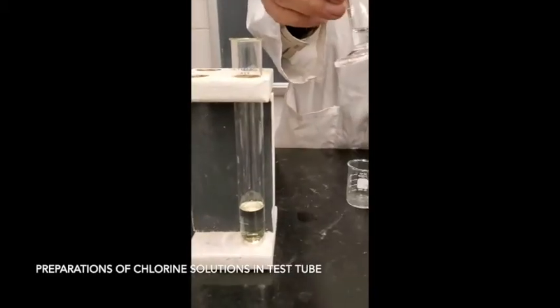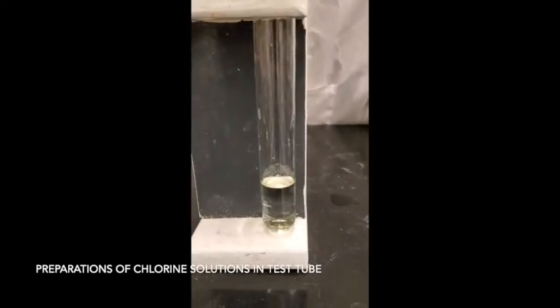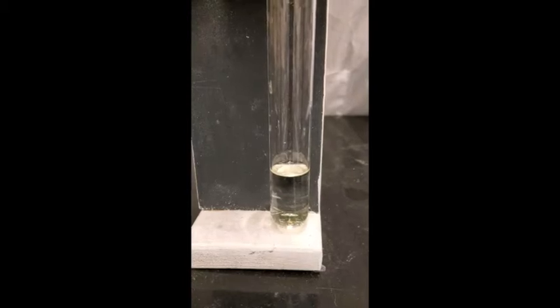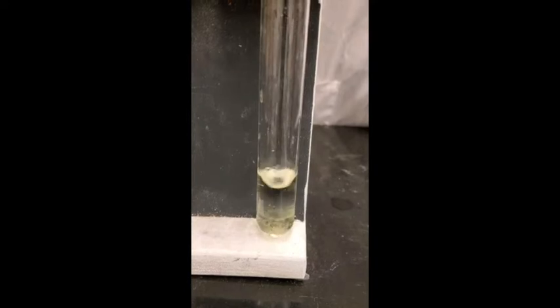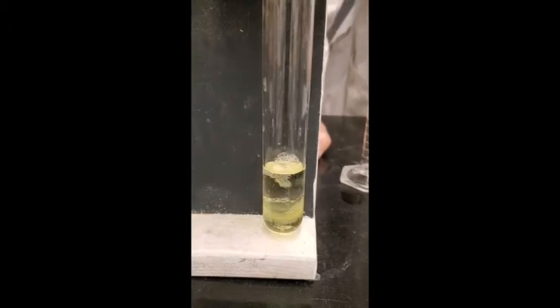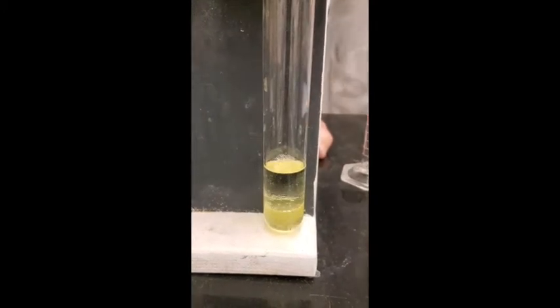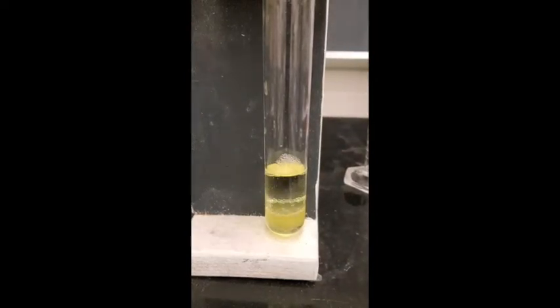Everybody, I have just a little bit of hydrochloric acid in here. I'm going to add it, and you're going to see the same reaction we saw before in that big cylinder, except that the chlorine is very soluble in the hydrocarbon. So any chlorine produced will dissolve primarily in that hydrocarbon. See, it's reacting. You see the green color being produced, and it should dissolve in the hydrocarbon.